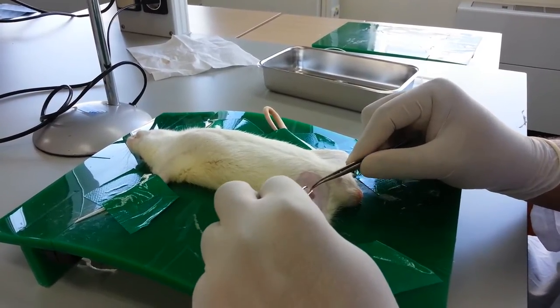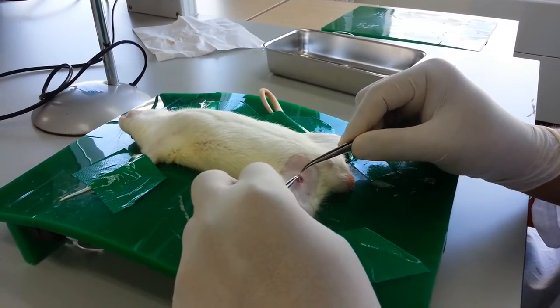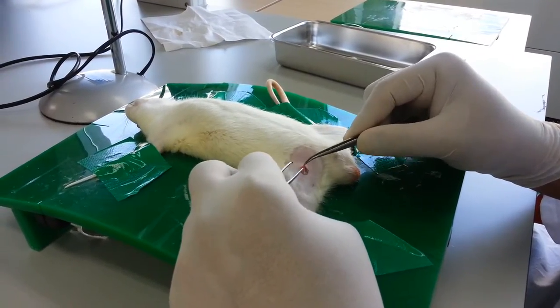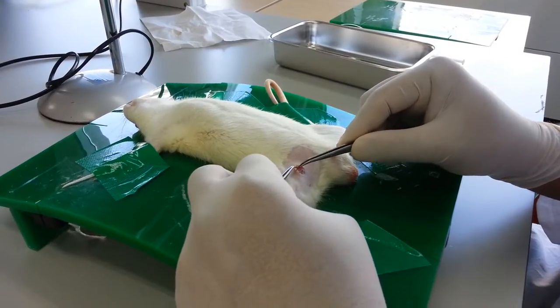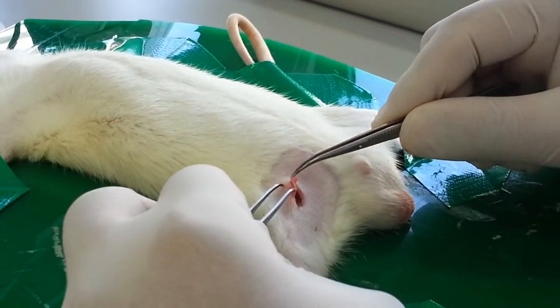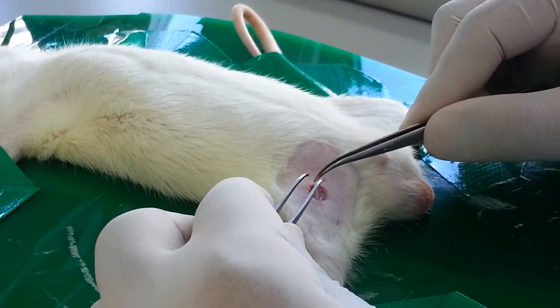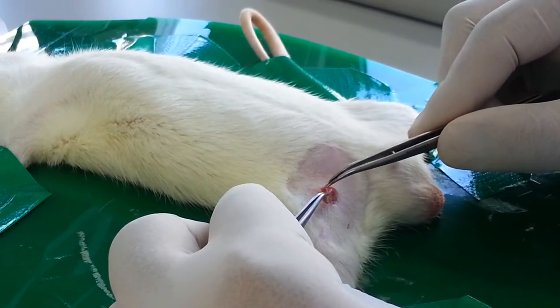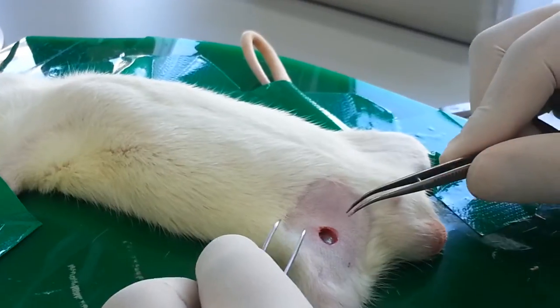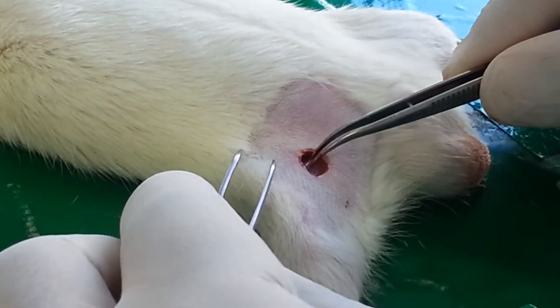You need to be very calm and very careful to do this because a small prick can make damage to the nerves. There are a lot of small nerves as well as small fat deposits — you need to be very careful while removing all those fats. There are also small membranes; these small membranes should be carefully removed. Here we can see the artery and vein are very clear now.